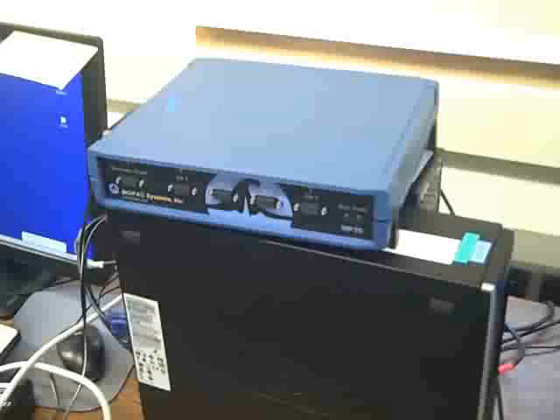Okay, the last thing of course is to make sure that you plug in the MP35. Alright, the last thing that we have to do is we have to power up the blue box. Hit the power button.